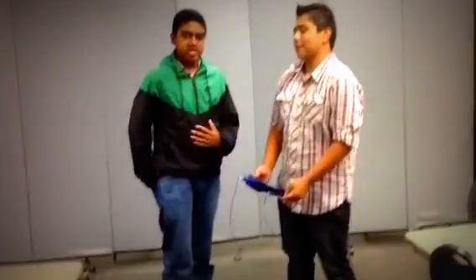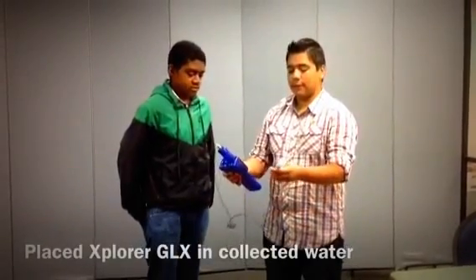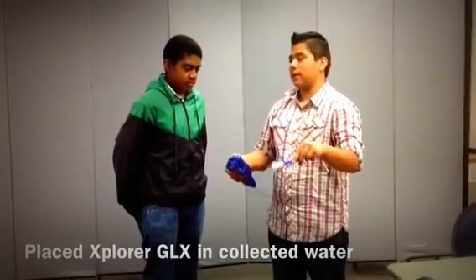This is Matthew, and we just tested the pH of the water at Grayson Creek. So what was the pH? It was 9.0. And how did you find it? We got this sensor for pH balance, and we put it in the water that we got.